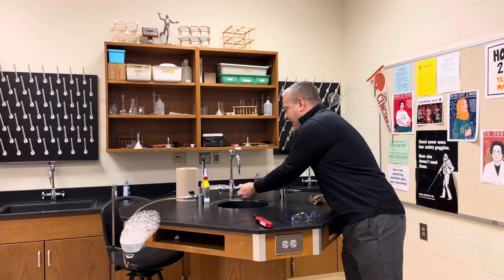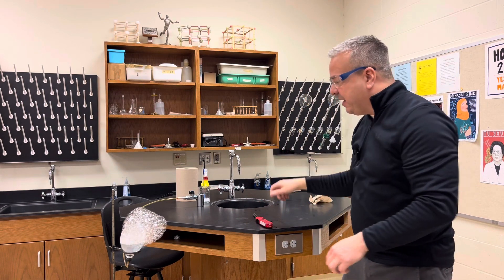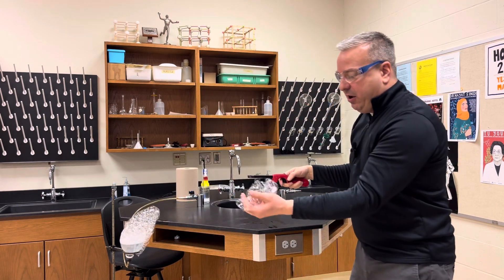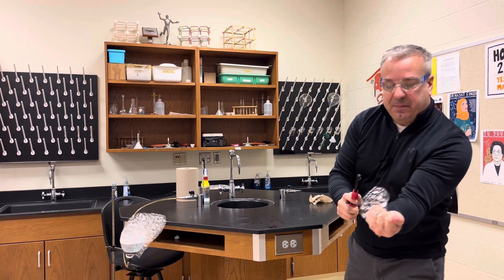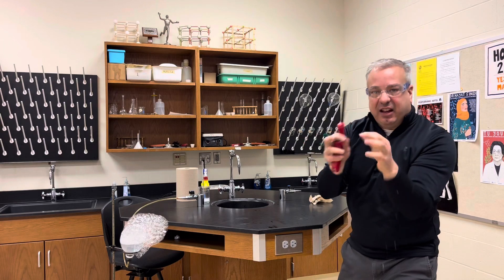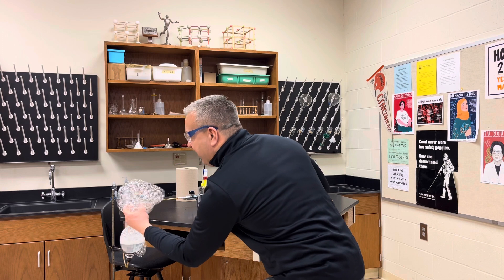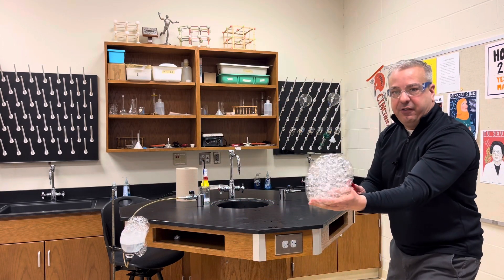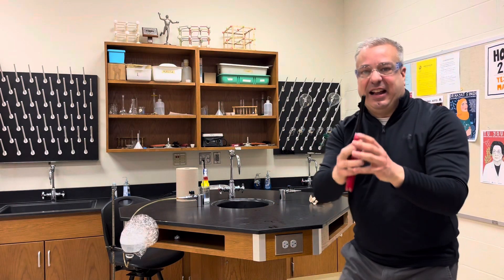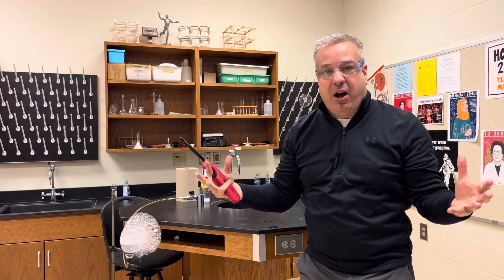I'm going to get my hand wet to kind of protect myself, and I'm going to wear some safety glasses. First, I'm just going to grab a small portion of the bubbles — just a little bit. I'll pop some, and you're going to see that we just get a little bit of heat, which would be much different than if I grabbed a whole bunch of these bubbles and lit them on fire — you're going to see a lot more heat and a bigger plume of that fireball.